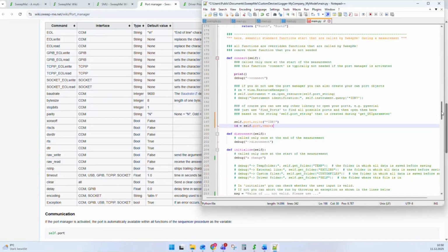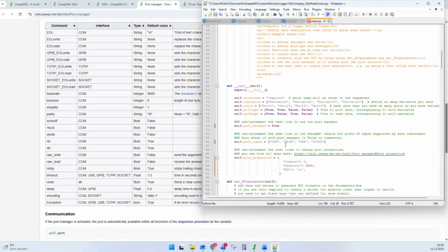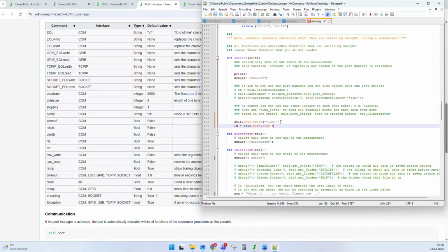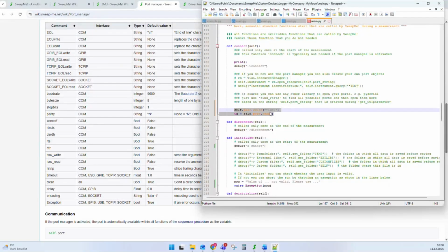And the nice thing of the port manager is that some instruments have multiple port types. They have COM port and GPIB port at the same time. And instead of writing into your code always something like if else, like if COM port, then use this, if GPIB, then use this, the port manager automatically wraps this into a single port object that can handle GPIB, COM port, USB TMC, TCP/IP, and so on, and sends the command correctly. And this means this driver then automatically works with all these port types, and you don't have to struggle with how to send a command via a socket or TCP/IP or GPIB. And that's the main thing. It means you write commands, you read them back, and you can store and handle them, and you can use basically pure Python in these drivers to handle your data and get your measurement.